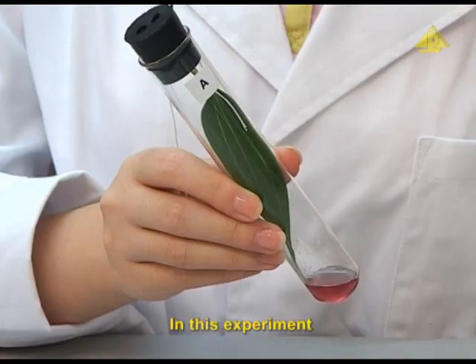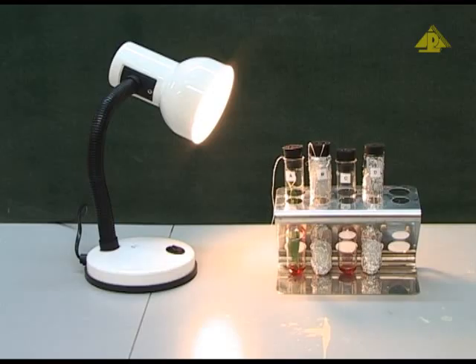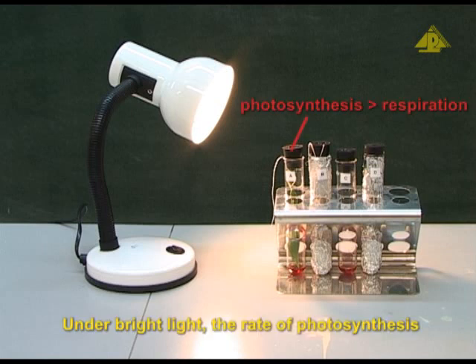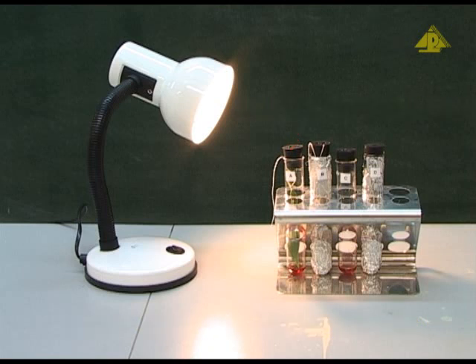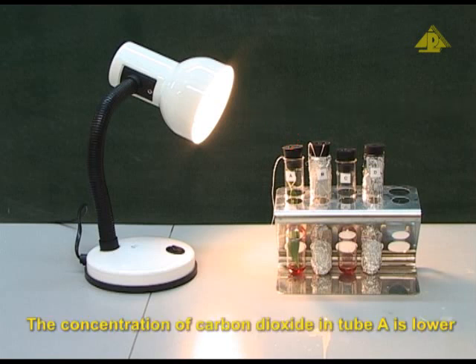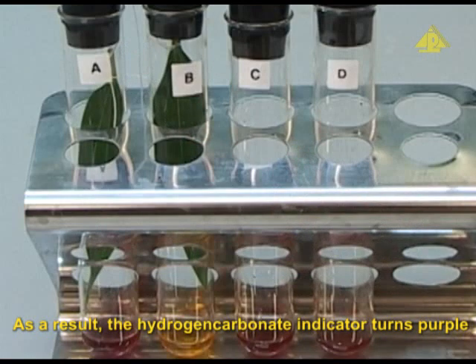In this experiment, boiling tube A represents a condition in the daytime. The leaf in tube A carries out both photosynthesis and respiration. Under bright light, the rate of photosynthesis is higher than that of respiration. There is a net uptake of carbon dioxide. The concentration of carbon dioxide in tube A is lower. As a result, the hydrogen carbonate indicator turns purple.